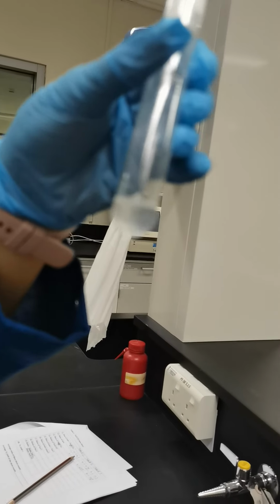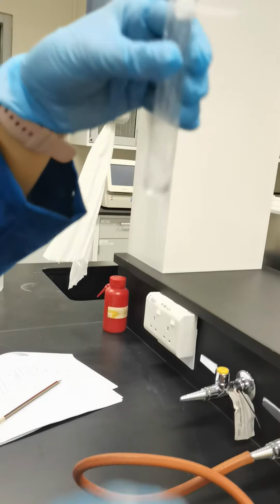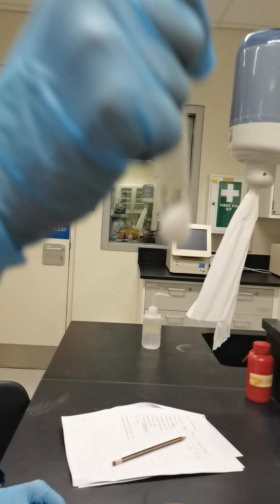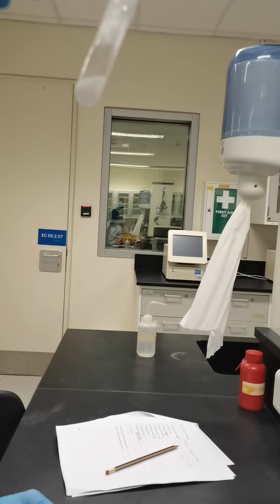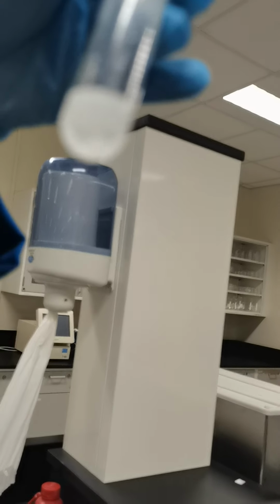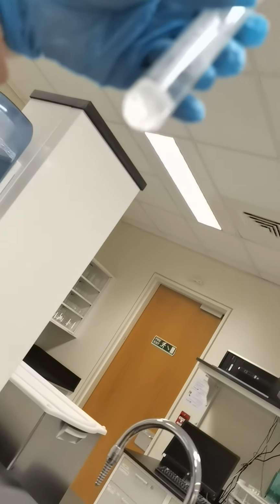So I'm adding a little bit more. Now, yeah, at the bottom you see, I'll try to focus.